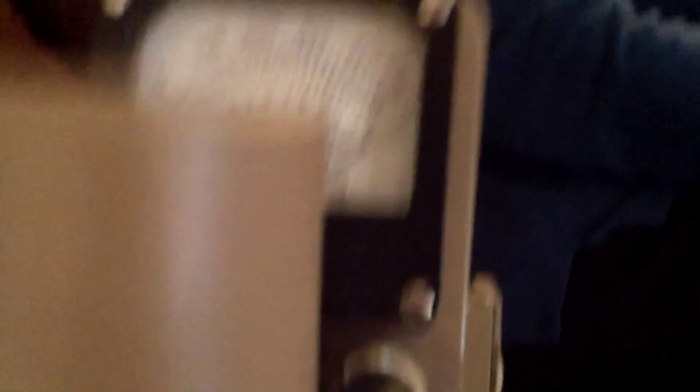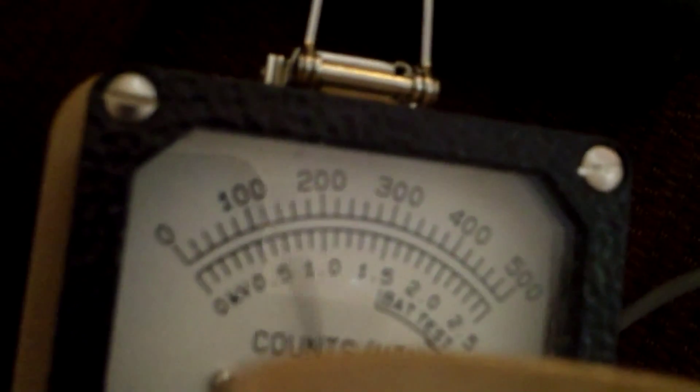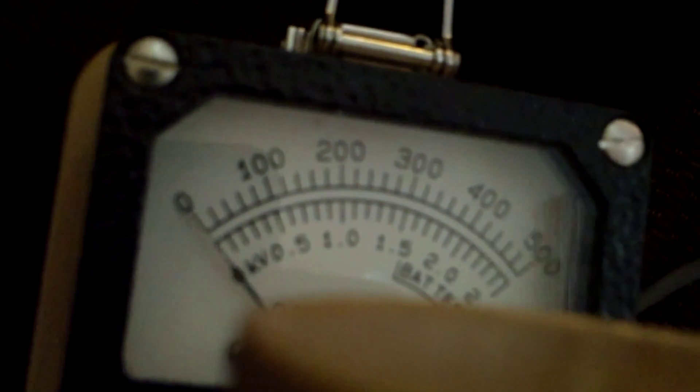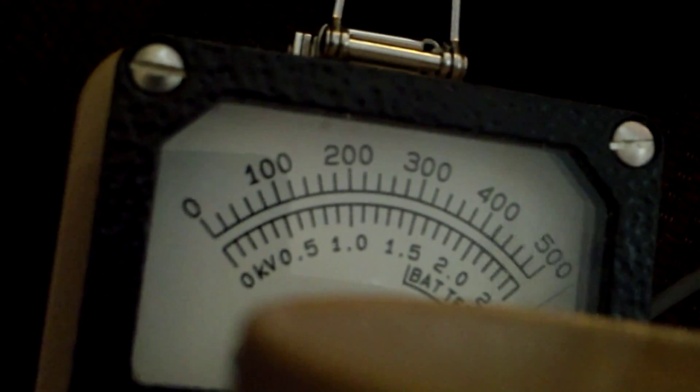Now it's the Ludlum's turn with a 1 inch sodium iodide detector. This is on x1000 mode. So, you're looking... As you can see, it's completely overloaded. When I hit the reset button, like now, it jumps right back up to hard over almost immediately.